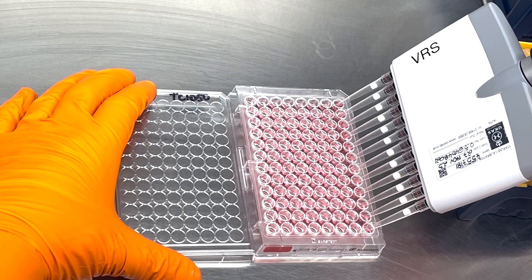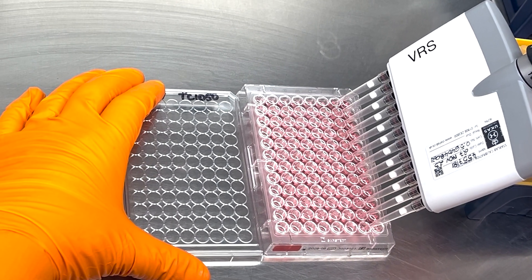Next, we proceed with a series of 10-fold dilutions, working our way down the plate.